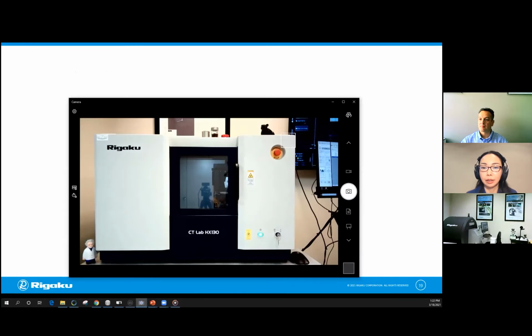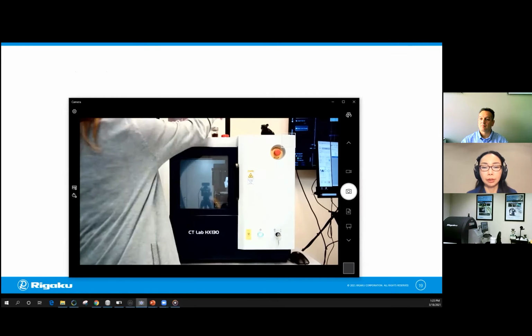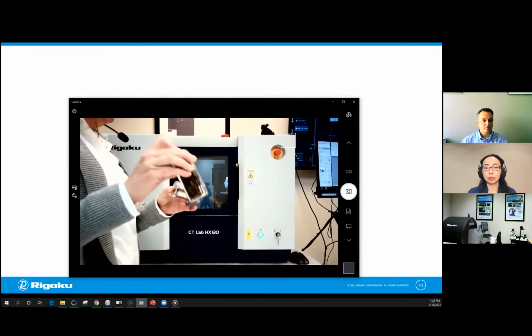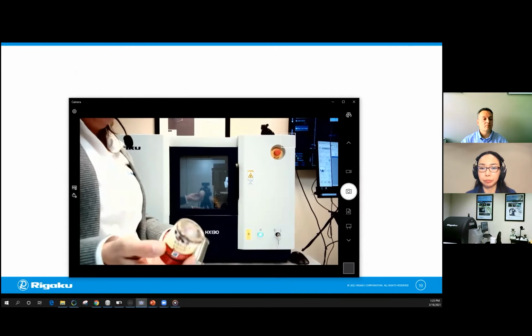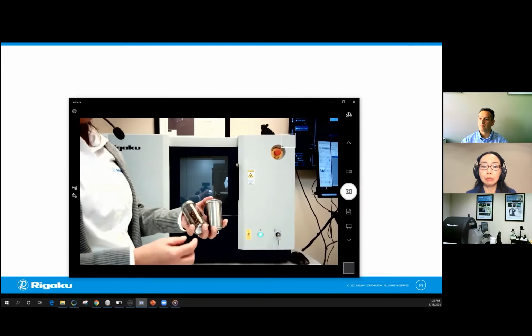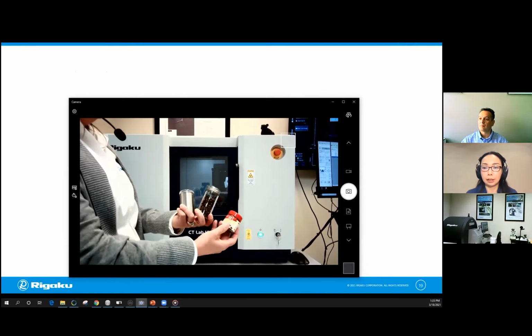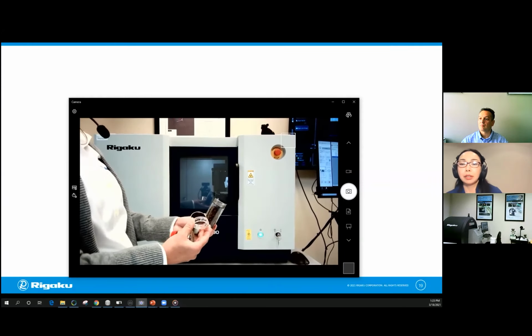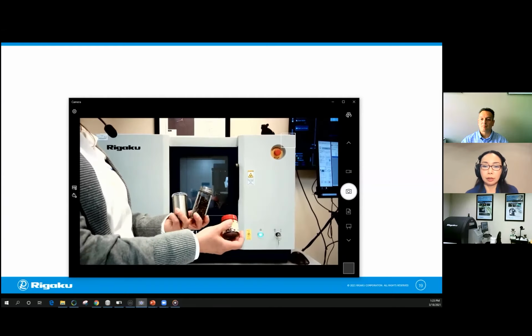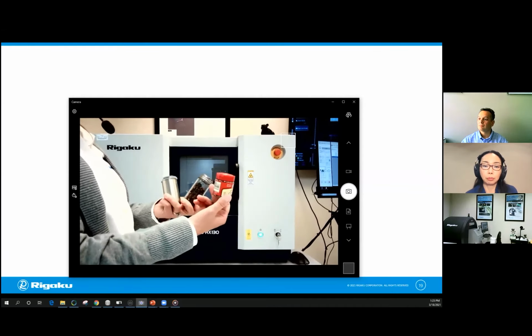Okay. So the next sample is cloves. They're in a container. And the question is, we actually prepared 3 different containers. If you were to image multiple cloves at the same time, you want to look at a bunch of them, then what would be the best container for this? You can use glass, metal, or plastic.